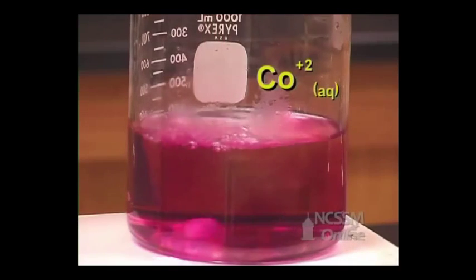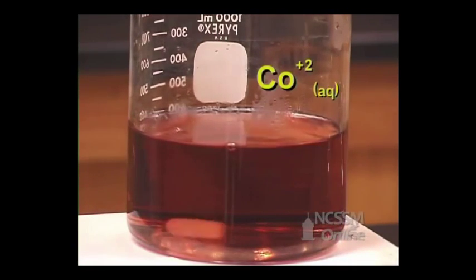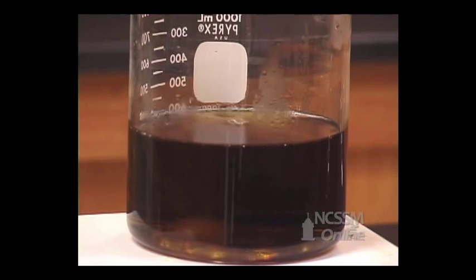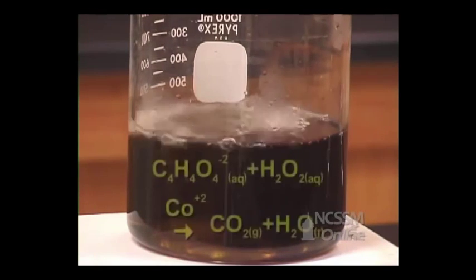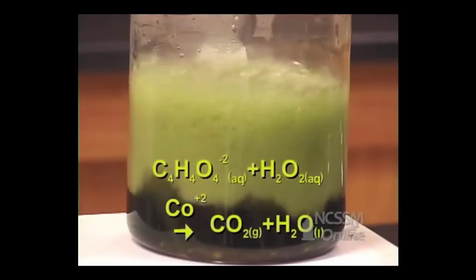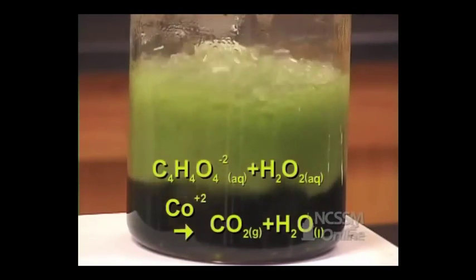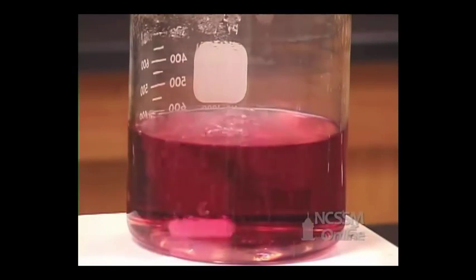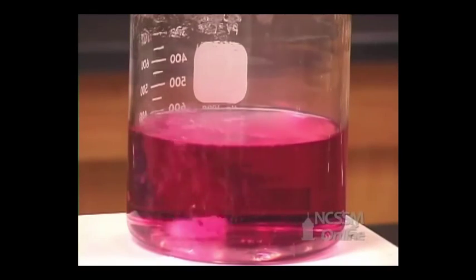The cobalt ion forms a complex ion with the tartrate ion. The solution turns green due to the formation of this complex ion. The reaction becomes very rapid. We see the evolution of carbon dioxide gas. At the end of the reaction, the solution turns back to pink, showing the regeneration of the catalyst.